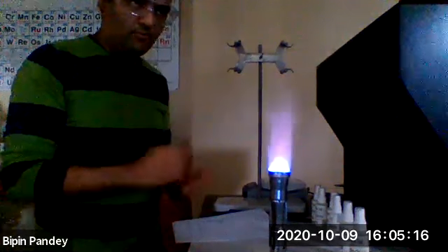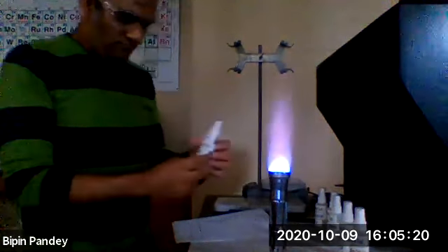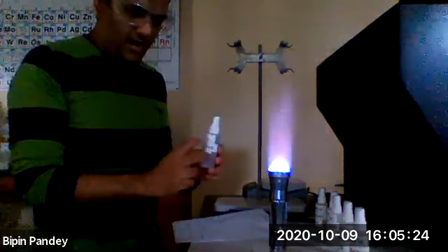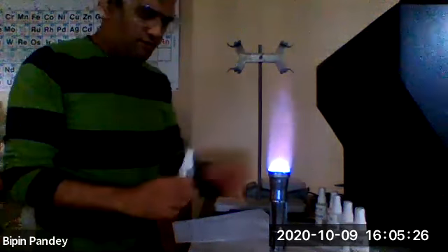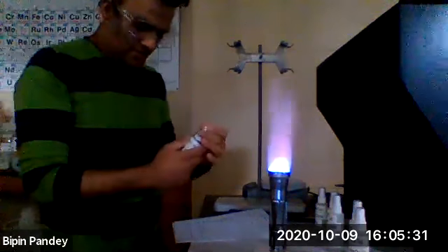Today's lab is about qualitative analysis, lab 9. We have two parts. The first part is the identification of cations. I have some metal solutions. I'm going to add these metal solutions to the flame and you need to record the color of the flame. So let's get started.